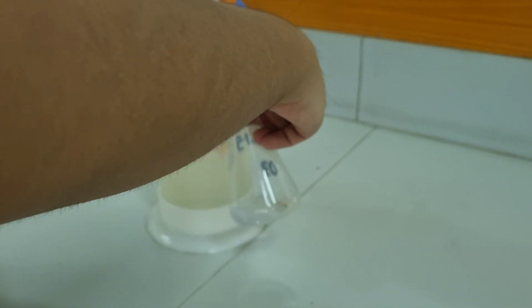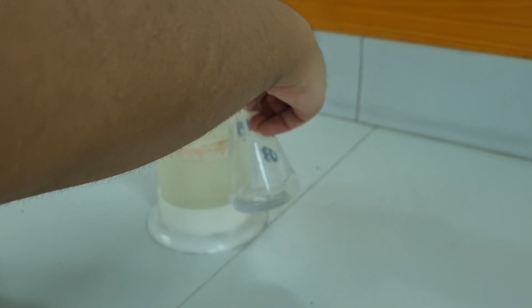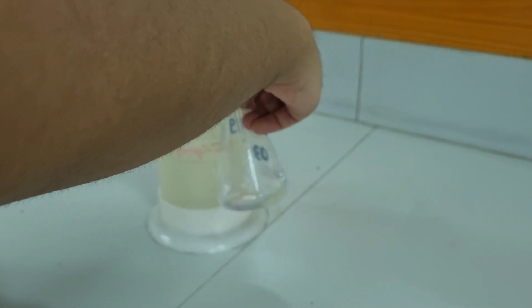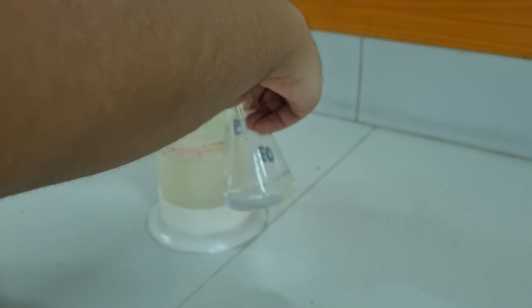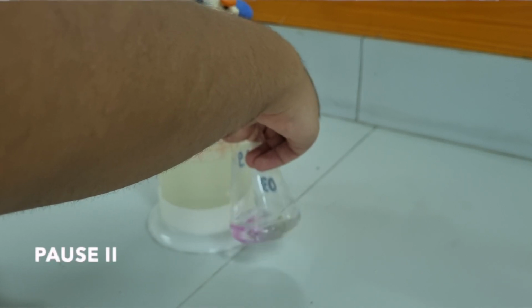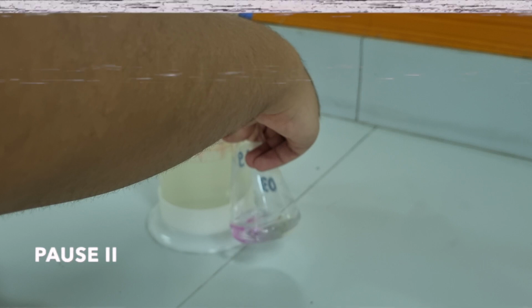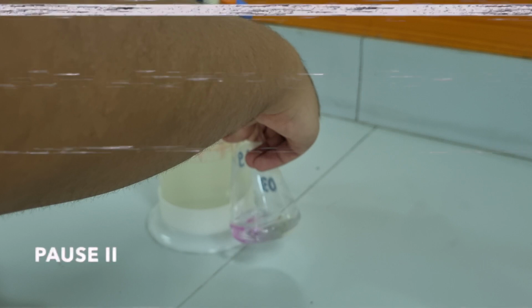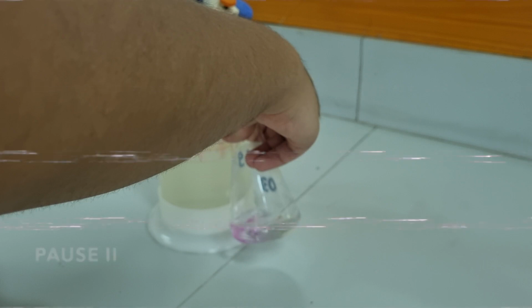During titration, I slowly add my titrant with one hand and make sure that the other hand vigorously shakes my flask. Upon addition of base, you will notice that the solution briefly turns purple. This is the phenolphthalein reacting to the base. I need to be careful, adding titrant dropwise when necessary so that I won't get to a dark purple color.